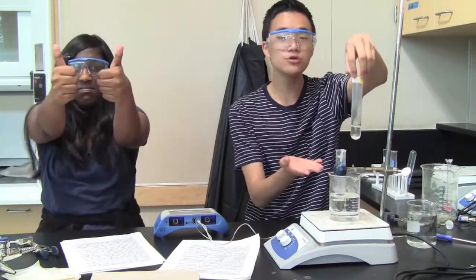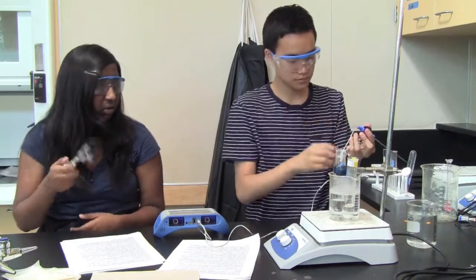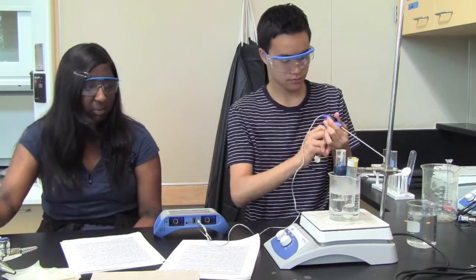When you start building the model, we have the solution in here because our setup people have done an amazing job with it, and it's melting. So now we will do the same thing. Exact same thing. No difference. For this lab, the difference is that you have an extra one. You have to show this.